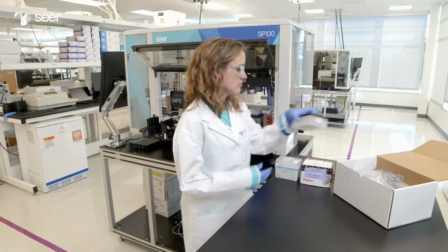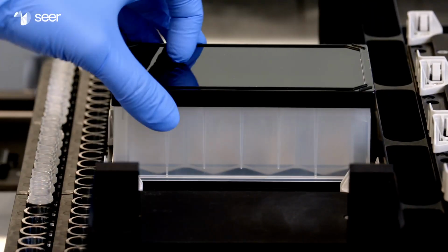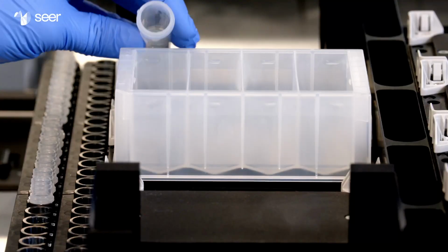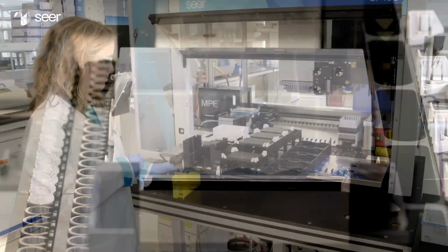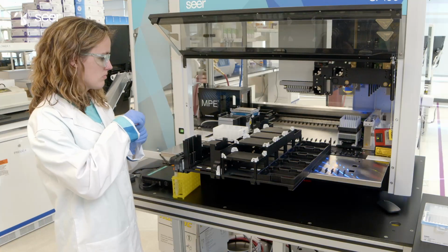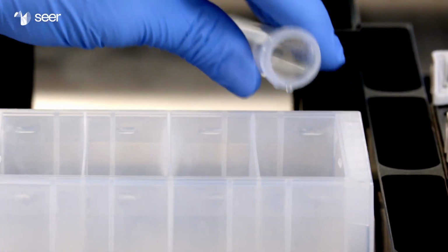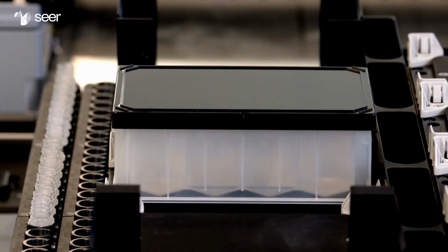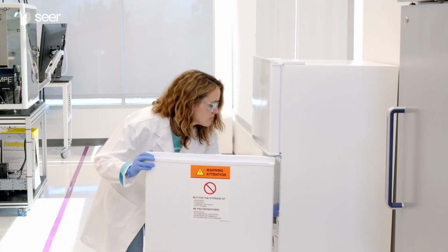Place the 4-well reservoir into position A3. Remove the lid. Add 10 milliliters of peptide elution solution into well 1 of the 4-well reservoir. Do not pour the entire bottle. Add 12 milliliters of fluorometric peptide assay buffer into well 4 of the 4-well reservoir. Do not pour the entire bottle. Place a black plate lid on the 4-well reservoir. Store any remaining peptide elution solution or fluorometric peptide assay buffer in the refrigerator.